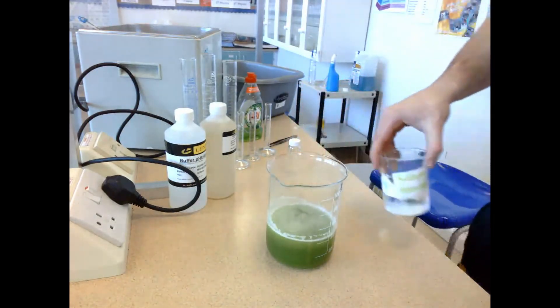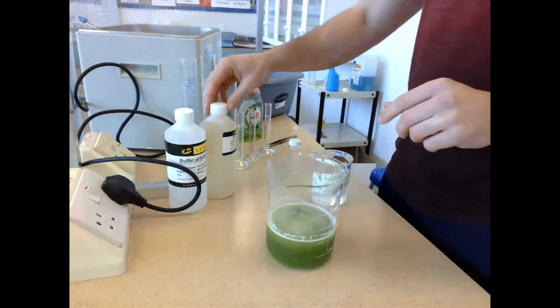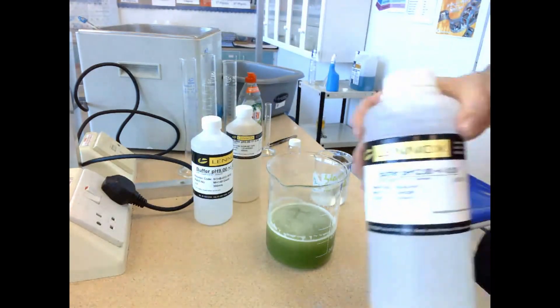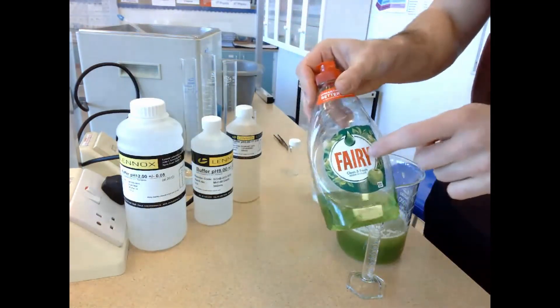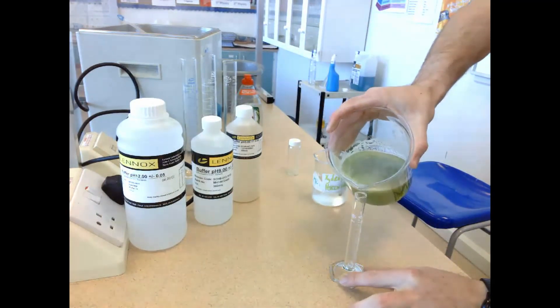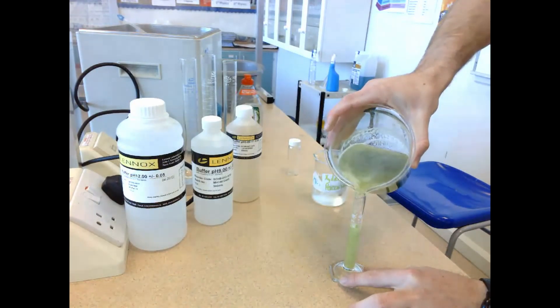I'm going to get hydrogen peroxide, which is what catalase works on. Then I'm going to get a pH buffer 3, pH buffer 9, and pH buffer 12, which is the range across which we're going to test the effect of pH. The washing up liquid is there to track the oxygen that's going to be produced as catalase breaks down hydrogen peroxide, and that oxygen will be trapped in the form of foam.